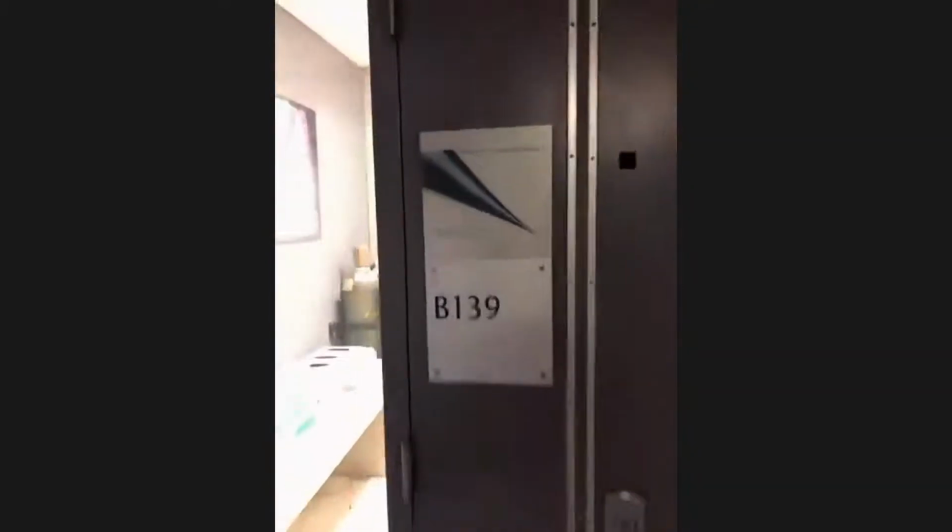And now we're going to walk across the hall to our last stop. And I guess I should point out, it's quite nice, right, that all of these labs are in the same building, right? You generally don't find this.